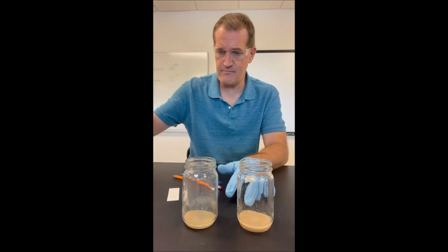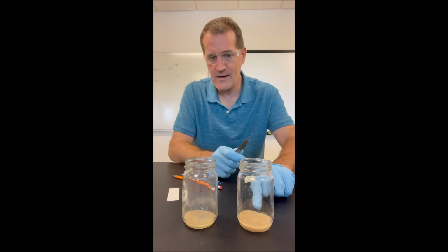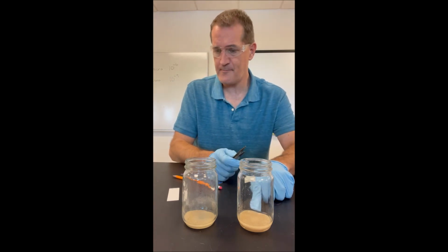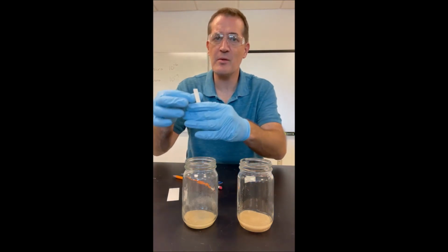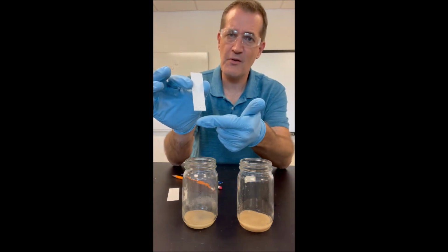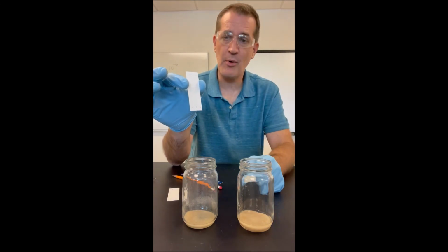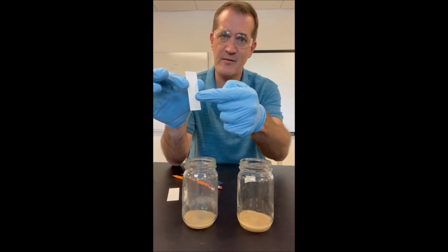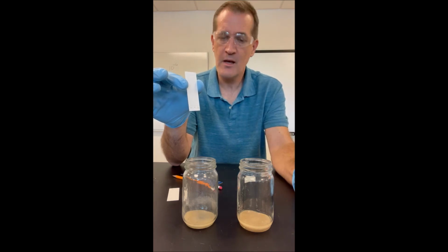And these have in them sand on the bottom for a level surface, and then a liquid, a solvent above that. And so what happens is, as the TLC plate goes in, the solvent rises up, and depending on the chemical makeup of each spot on there, it'll get pulled up with the solvent or it'll stick to the plate. So the point is that each spot will rise up a different distance.